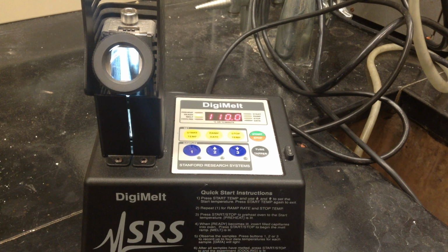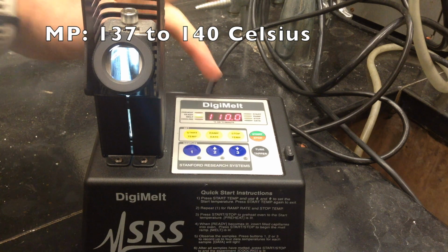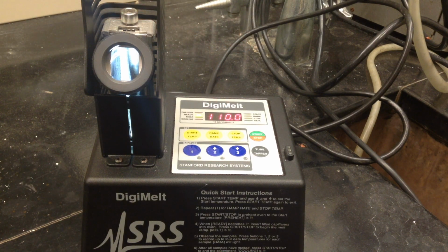Alright folks, we're going to get the melting point of maleic acid. Remember, its melting point's about 130 or so. And because I knew that we were going to have a fairly pure sample, I already started the temperature at 110. I'm going to ramp it up at about 10 degrees a minute, so about every 6 seconds we'll go up a degree. And then I'll have it stop at about 150 or whenever it melts, really.